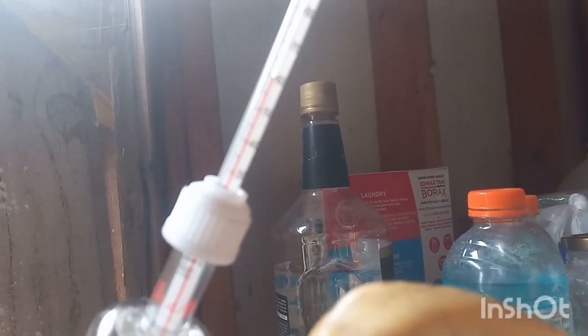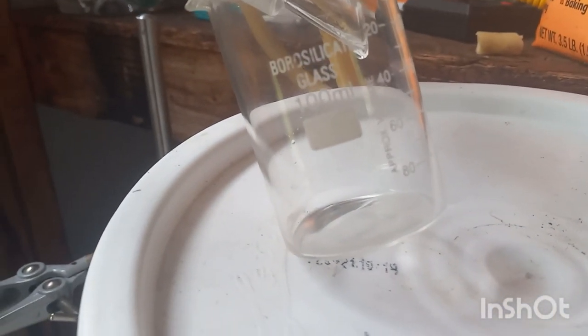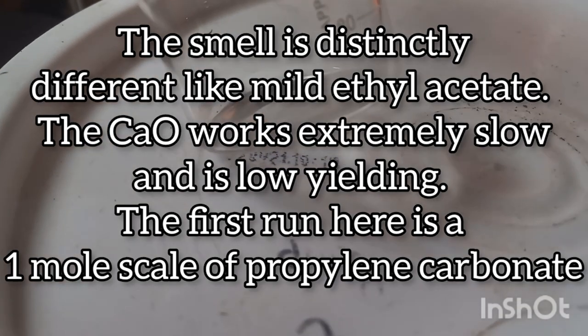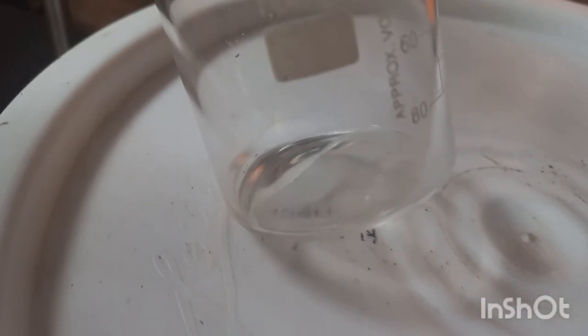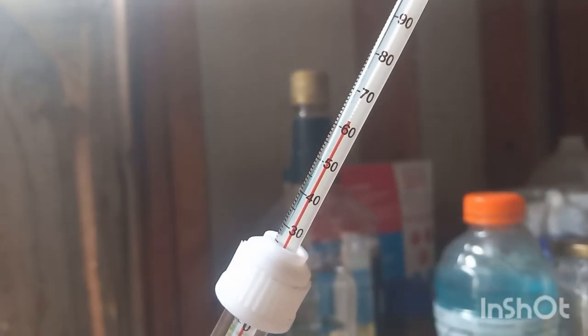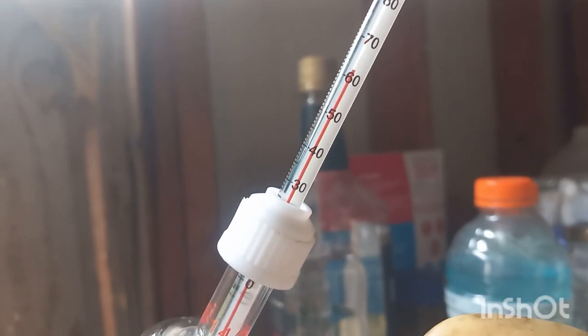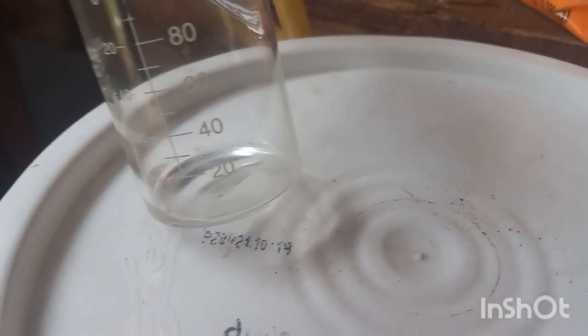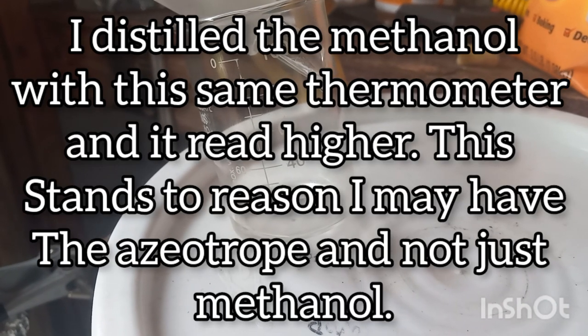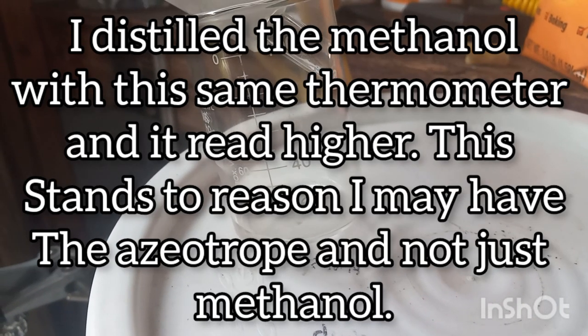Concerning. Okay. Might be from the ice I just added, but we've got a few drops, and it definitely is not methanol or propylene carbonate. It's got more of a solventy smell to it. Very exciting though. It steadily held about 63, the azeotrope temperature. We're starting to get an okay flow rate. Very slow, but hey, whatever.